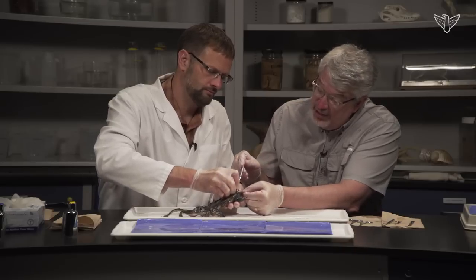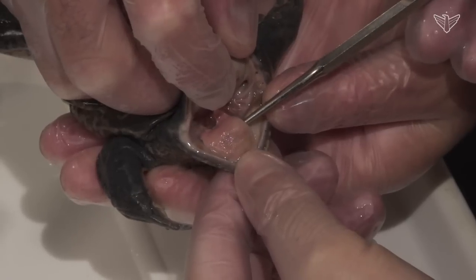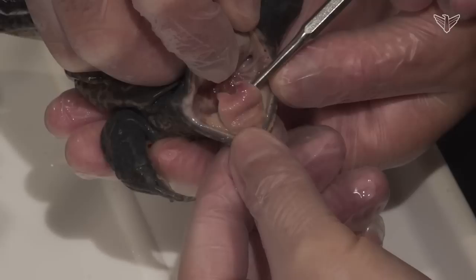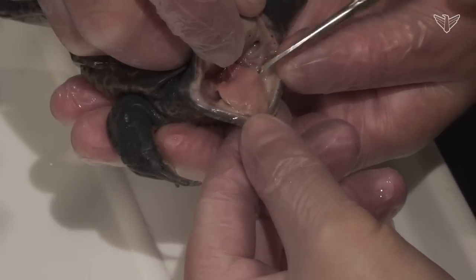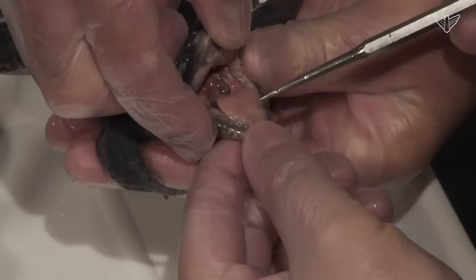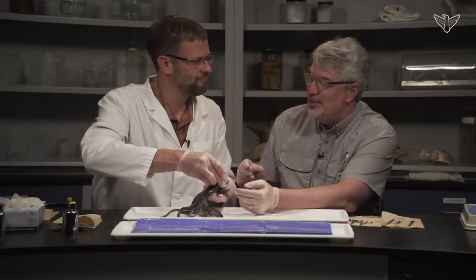You can look inside, and first of all, what you really notice is this large, fleshy tongue, which is an adaptation for terrestrial animals. It's hard to catch food in a terrestrial environment — you can't just have water currents carry it into your mouth, so you need to grab it and swallow it. What's unusual about a frog tongue is it's hinged here in front and the back is loose, so they basically project that tongue out of the mouth. It pushes out with hydrostatic pressure, has a sticky end, catches an insect or whatever, and pulls it back in.